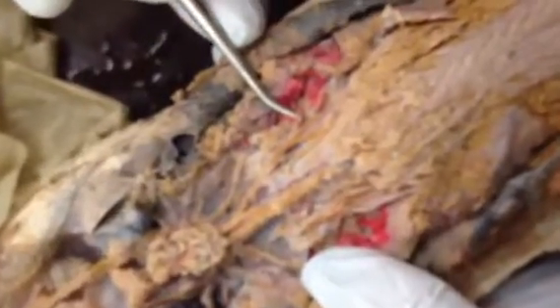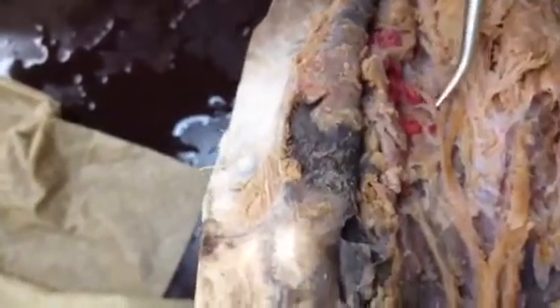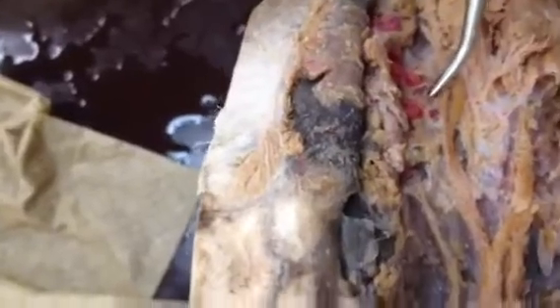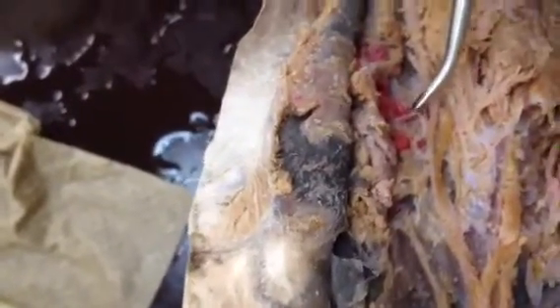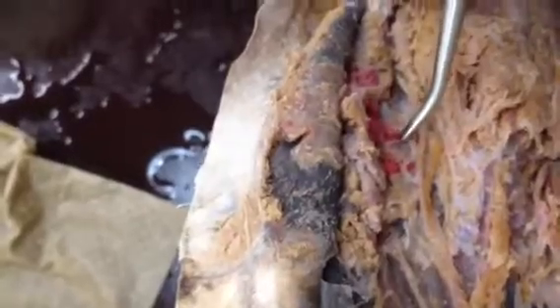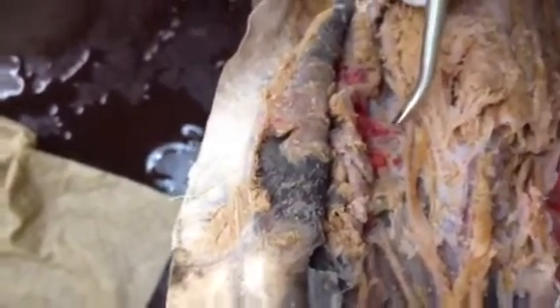Then the branches to the branchial. This one is the branchial. When you lift it, there are three. This one is the post, this one is pharyngeal, and the other one is the pre.